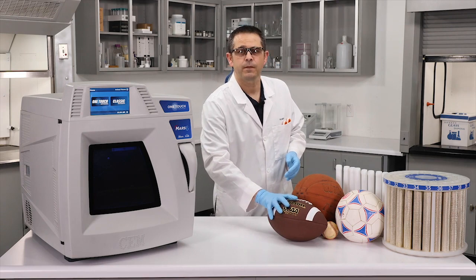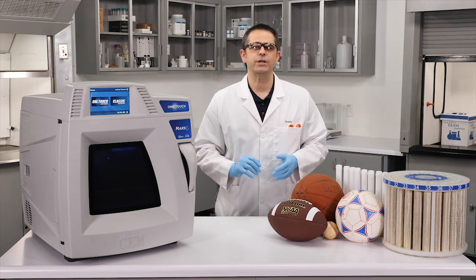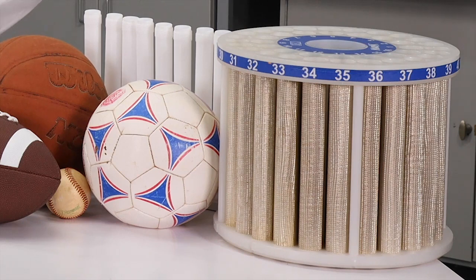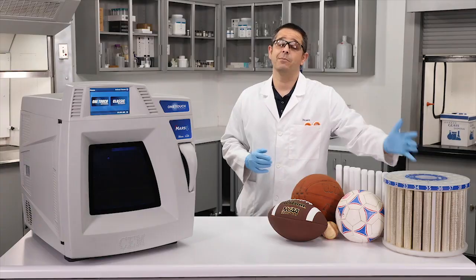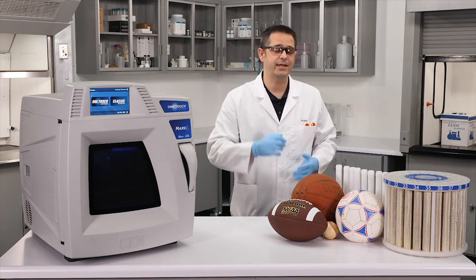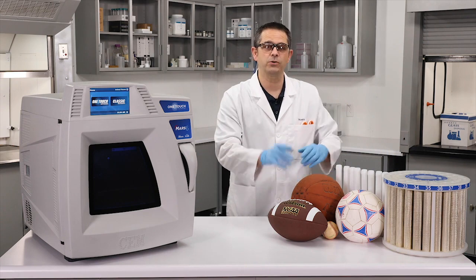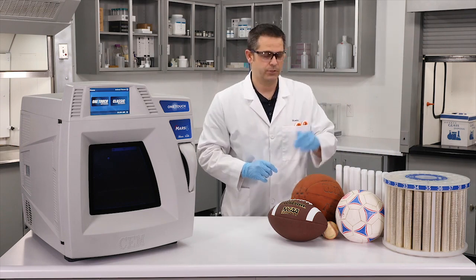Now, leather is a natural product, so we should be able to digest it in nitric acid only. Due to moderate temperatures and pressures required, we will use our Mars Express 75 mil vessel. We could run up to 40 samples at a time, but I must have done something right because today I only have to run eight samples, which will be all four balls run in duplicate.